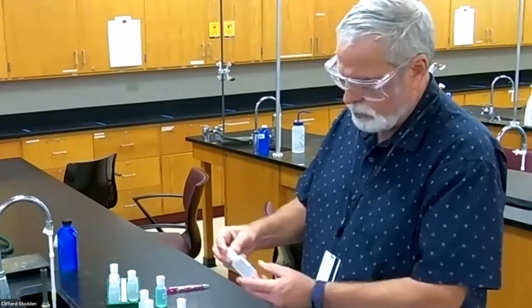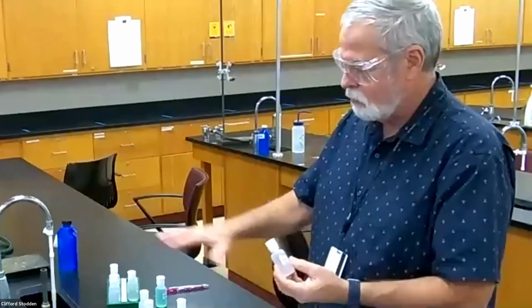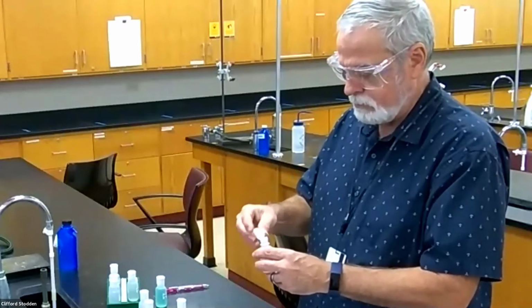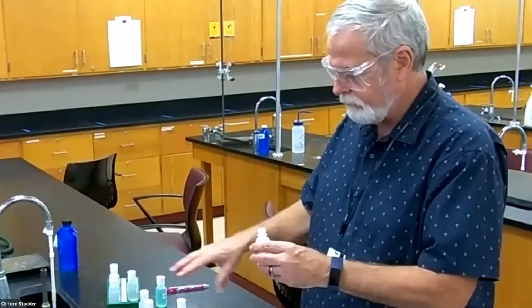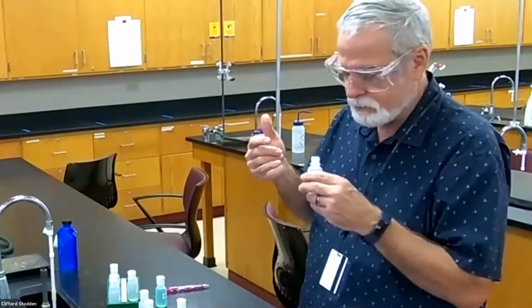hydroxide. One other thing about ammonium hydroxide, this is the one that you could identify by smell. So that's one of the other things you can do at the beginning when you're doing these analysis is take the lid off each of them one by one and waft it for yourself to see if you can tell that smell, that ammonia smell.